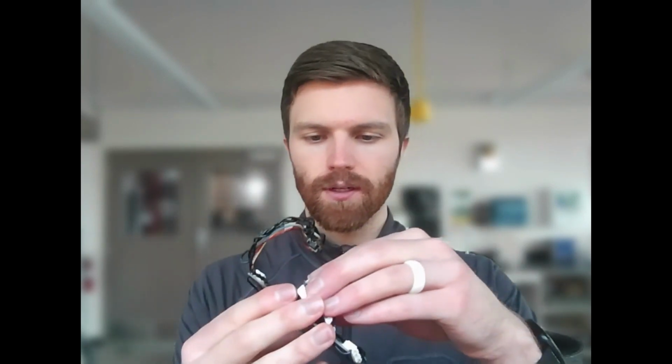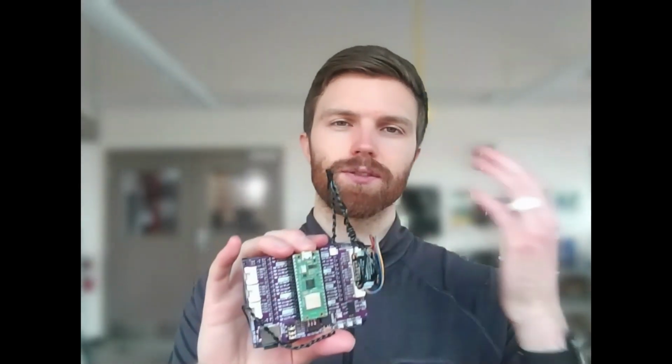We have our Pico wireless microcontroller, which fits into a kind of educational kit and base, the MakerPi Pico. We upload our source code onto the Pico microcontroller. It connects to the internet, and then we can send commands over a framework called MQTT. It's a standard in Internet of Things style communication in order to control the brightness of each LED, and also measure the light sensor data there.